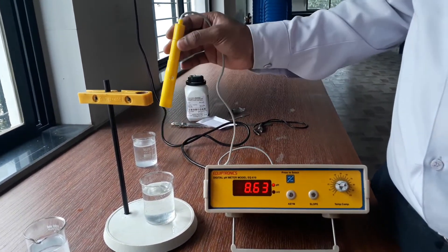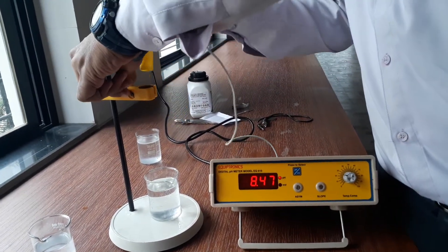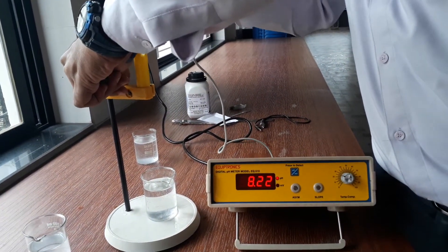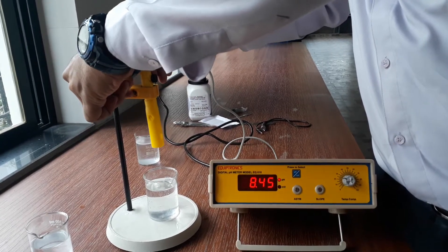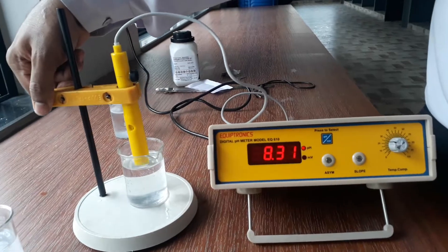That is distilled water. So after dipping we will see there is a change in pH. Now we are going to dip this in the first solution that is distilled water.